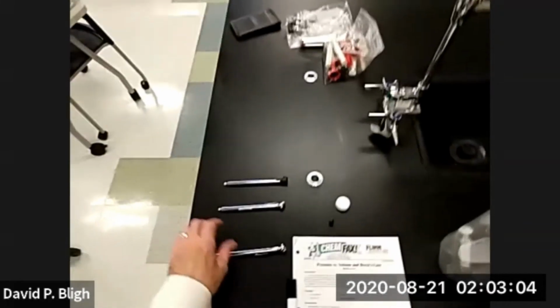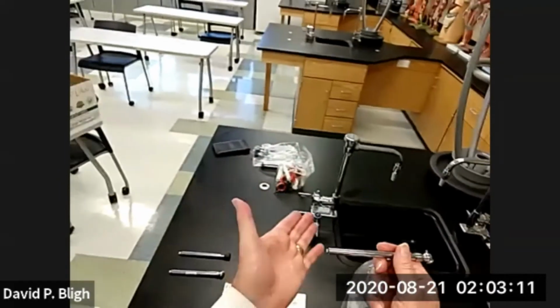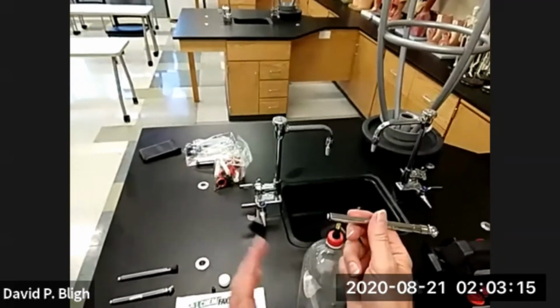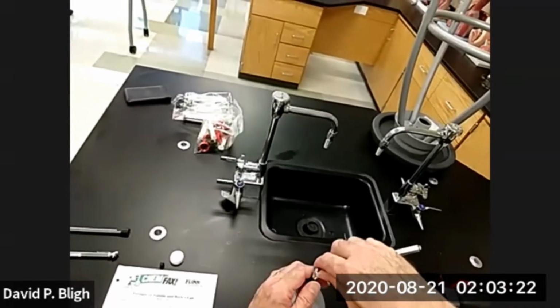We're going to start with the high pressure, and everybody knows how to use a gauge. You be sure that the plunger of the gauge is pushed to its bottom. Then you position it over the valve and press straight down.